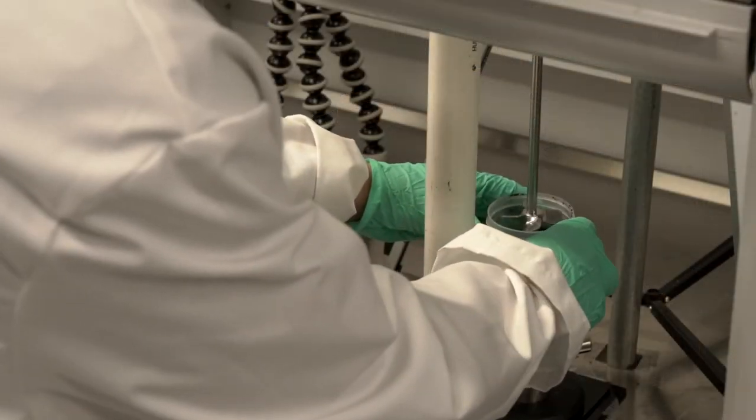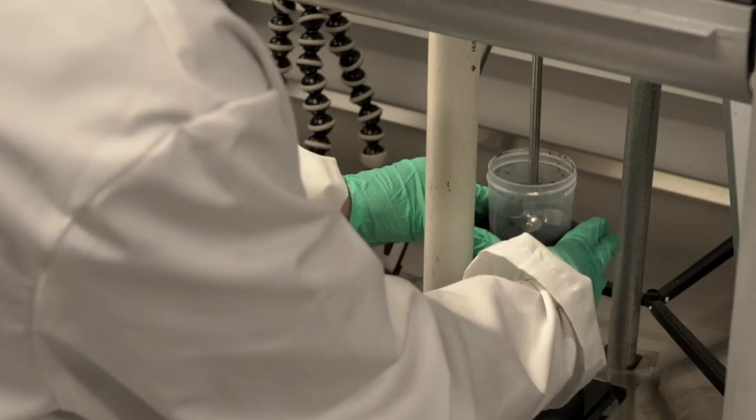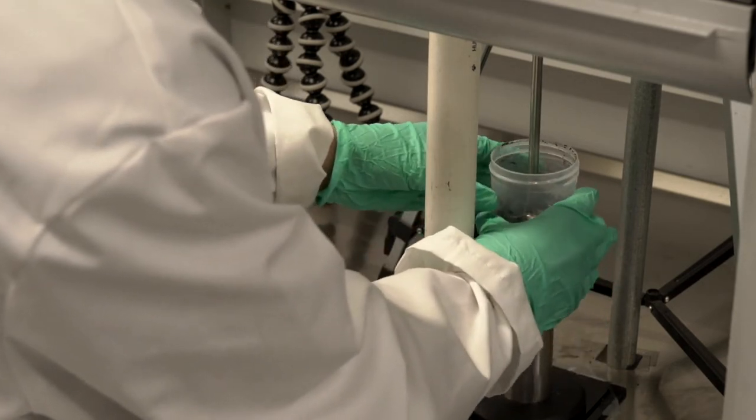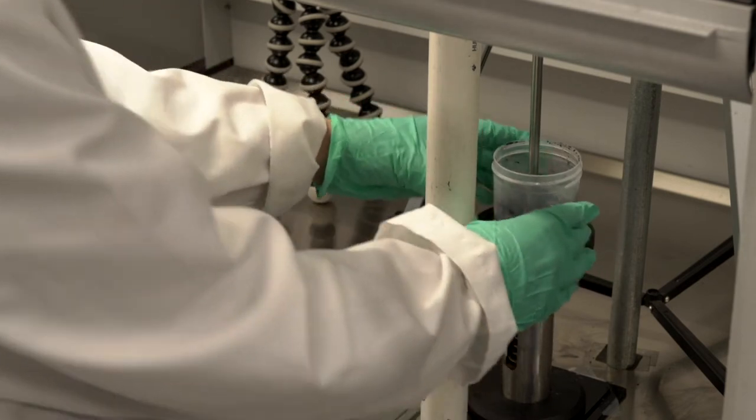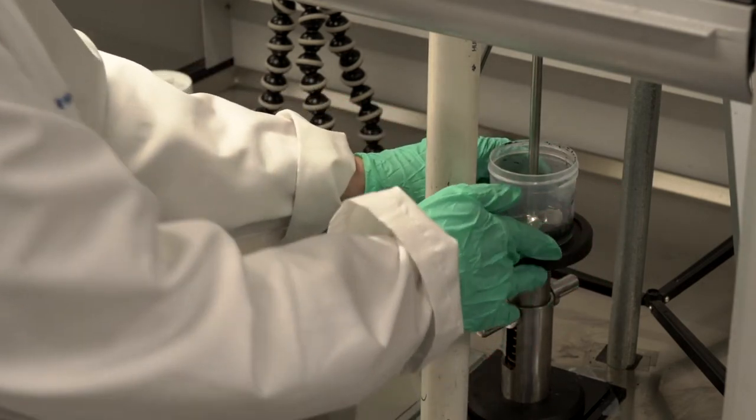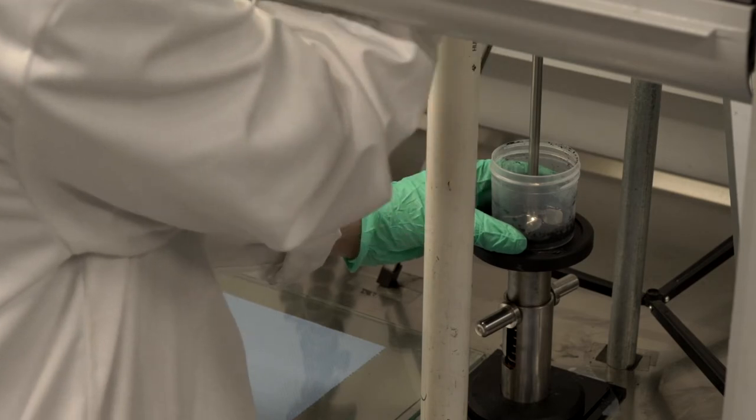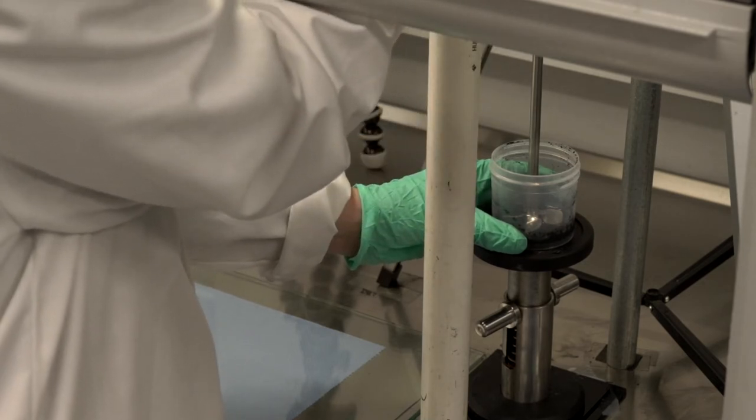So I want to mix this for five minutes at 1500 RPM. You see there's not much liquid in the cup, but I have just enough contact that it'll get a good agitation. Turn on my mixer and I'll start slow and ramp up the speed.